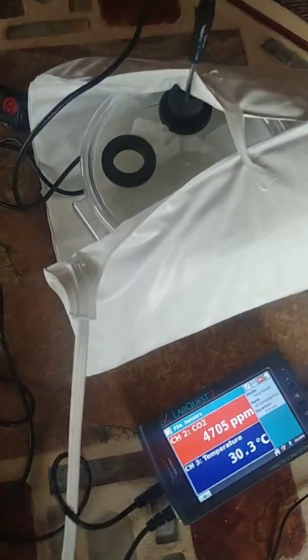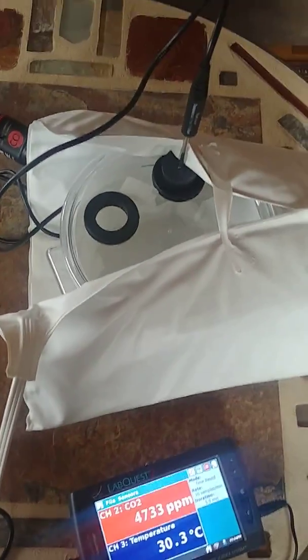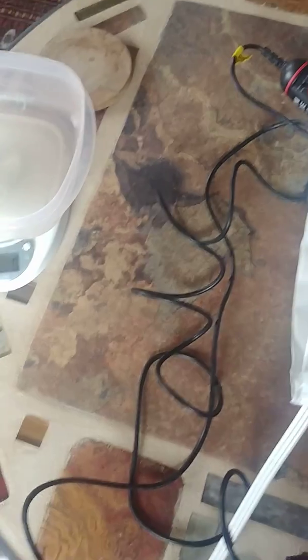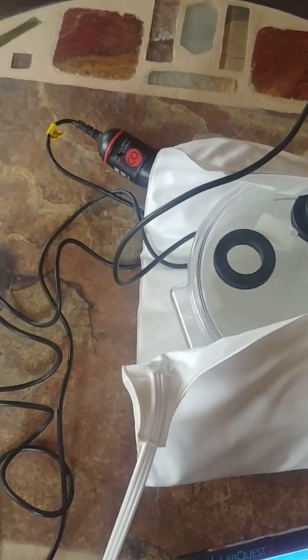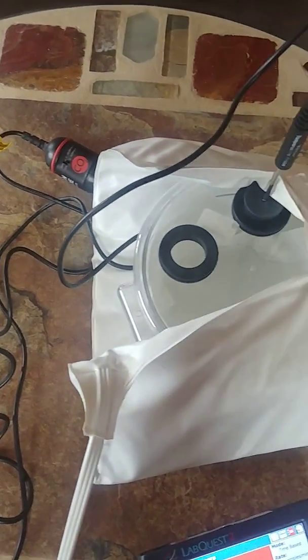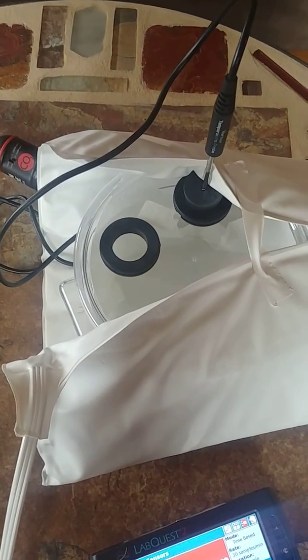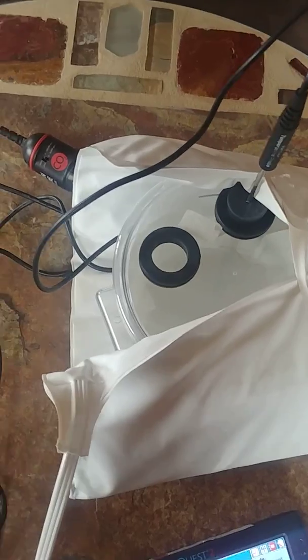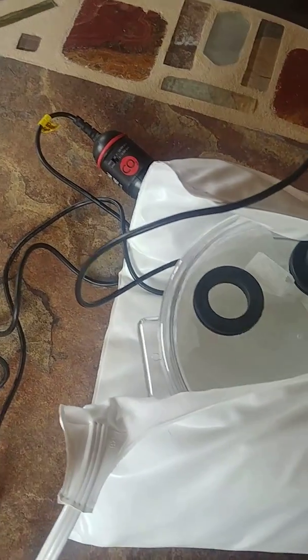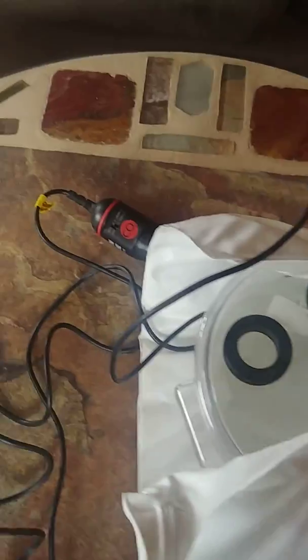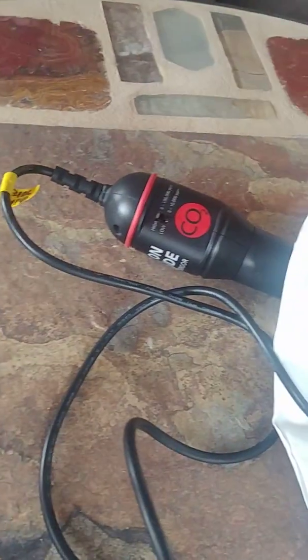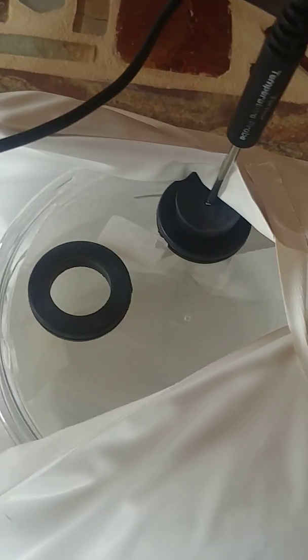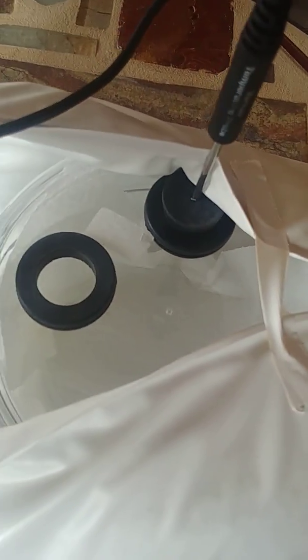So okay, we've gotten up to 30 degrees so we're ready to start measuring his metabolic rate. So remember cellular metabolism. When an animal is going through cellular metabolism, they're breaking down sugars and they use oxygen to do that and a byproduct of that metabolic process is carbon dioxide. So this little thing here is actually a carbon dioxide sensor. So we're going to measure the carbon dioxide in this chamber as Wallace sits in there.